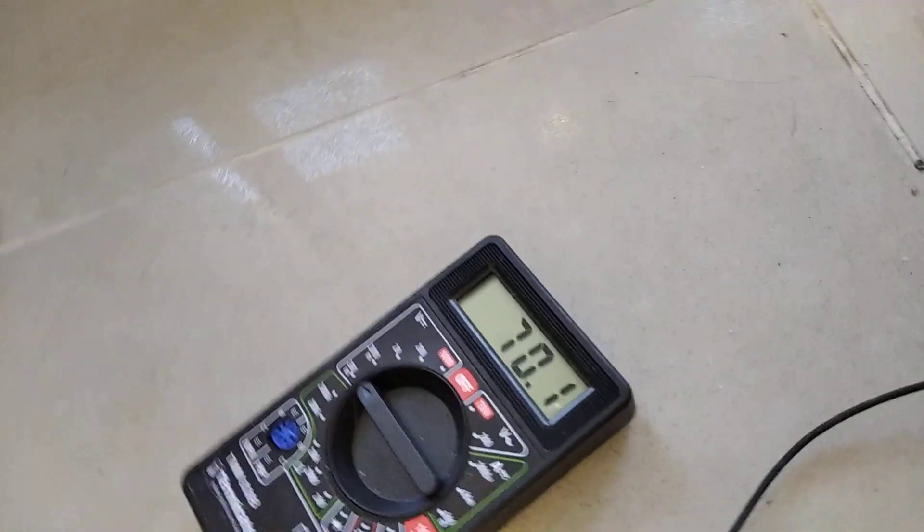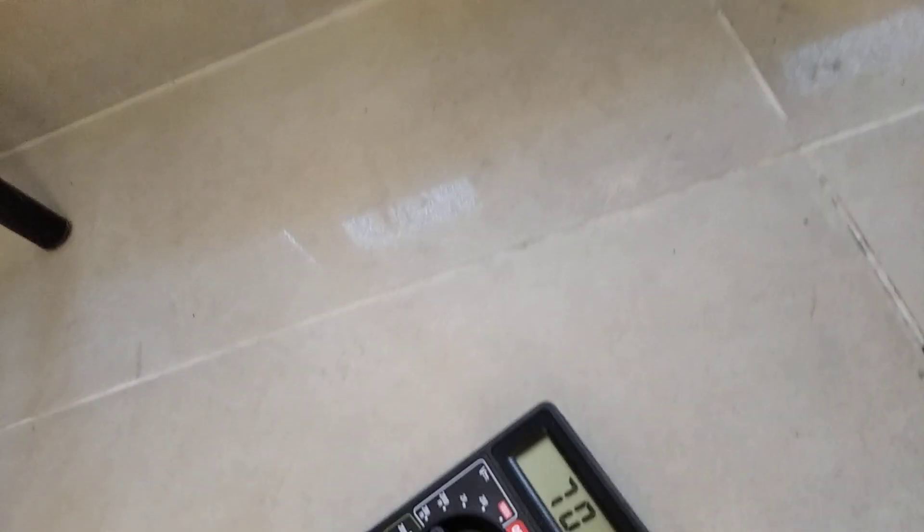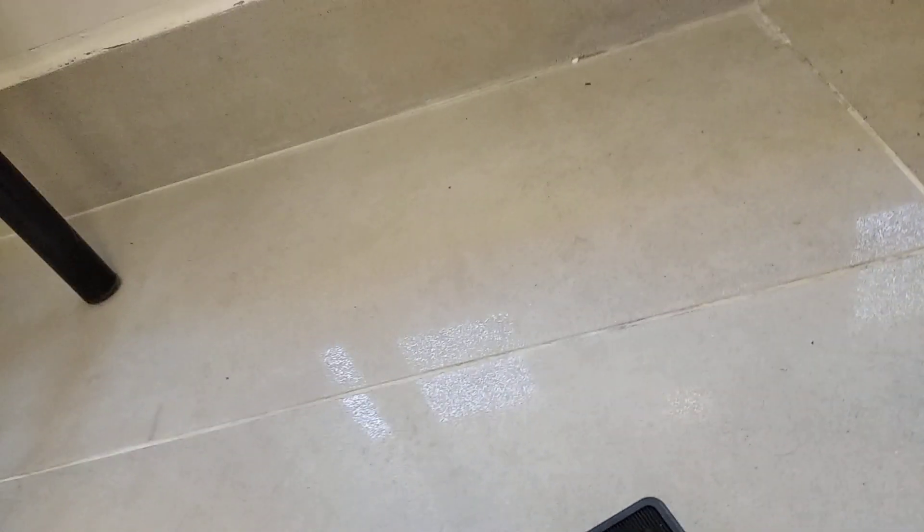And this is the voltage across these two points of the wire. And I've made a calibration table before running the cell where I use this multimeter to measure the current. And I use a resistive load adjusting the voltage of the supply and generating a table. And using Ohm's law I was able to find with pretty good accuracy the resistance between these two points over here.